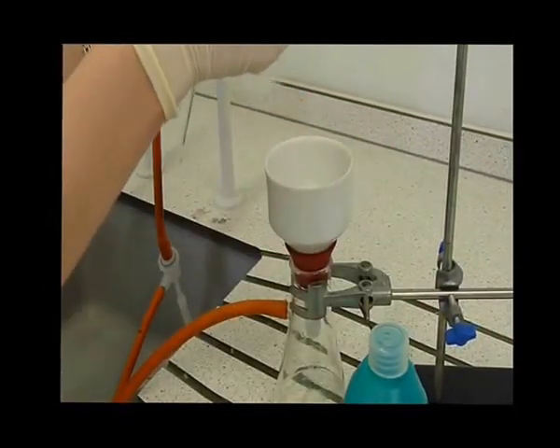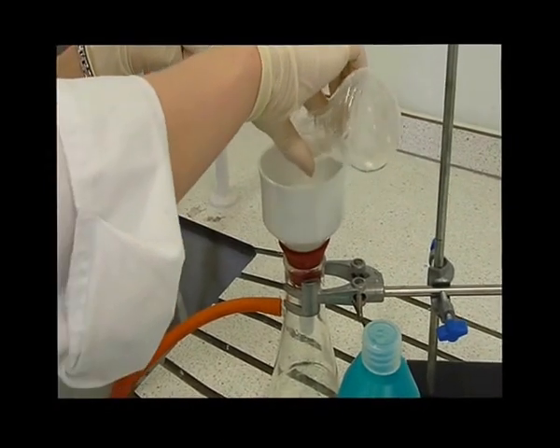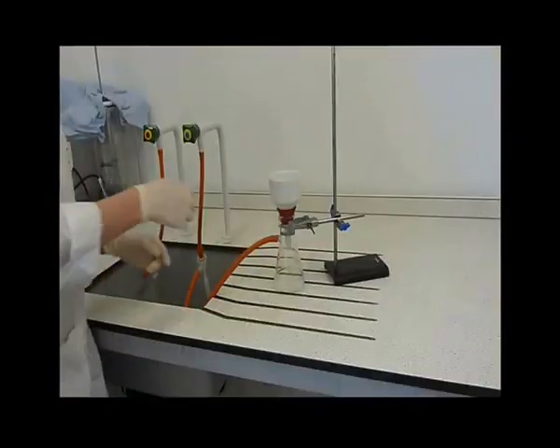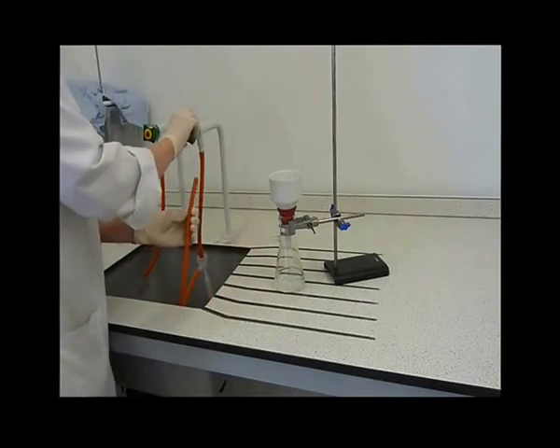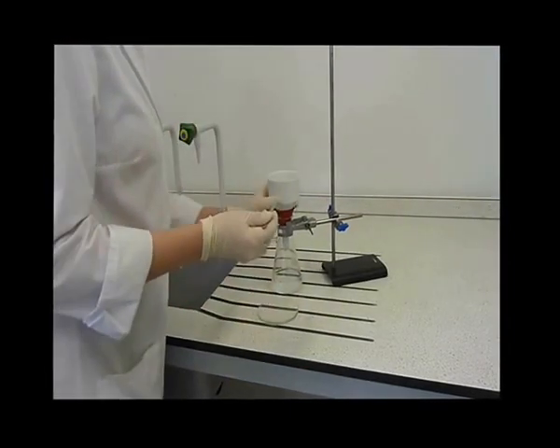Check that the filtrate is clear. Continue to vacuum until the solid is dry. Remove the hose from the Buchner flask to prevent suck back and then turn the water off at the tap.